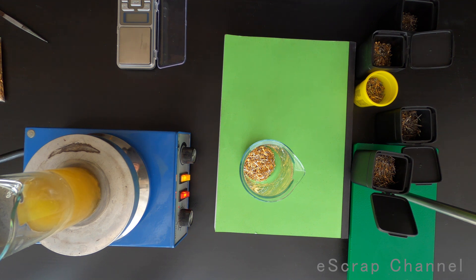As per the instructions, we have to wait until it is fully dissolved. I will check what's the time now and let's see how long it will take for this gold leaching agent to fully dissolve in water.